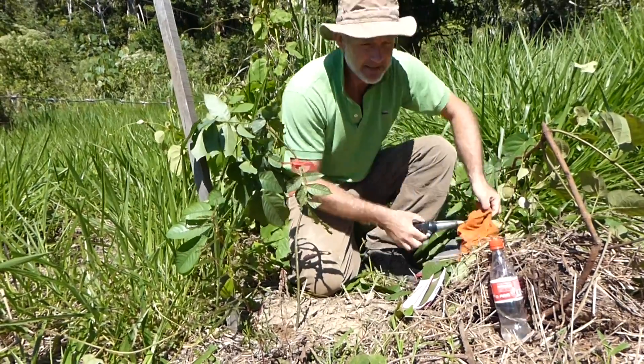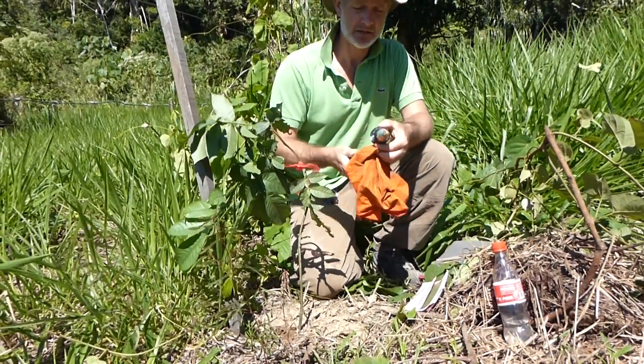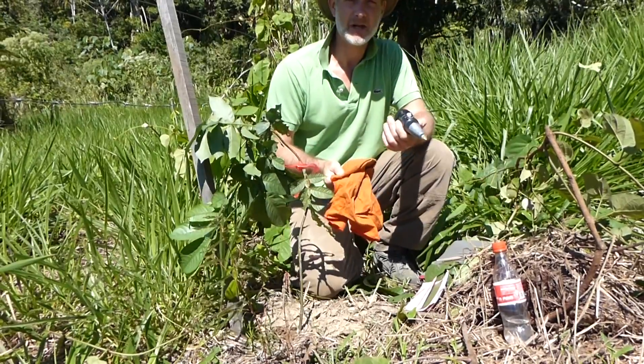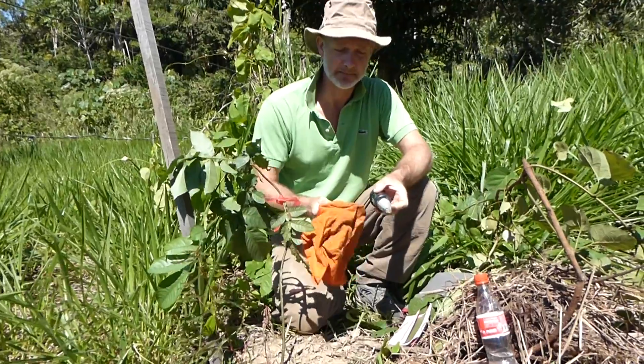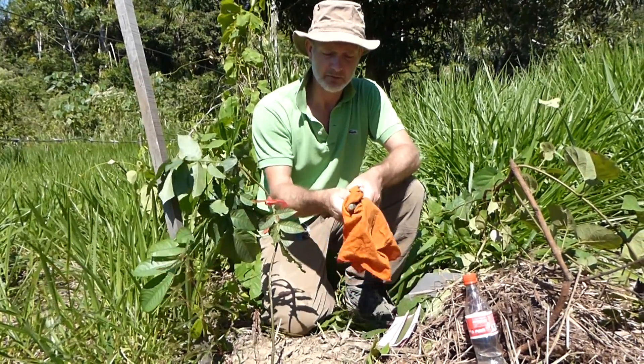In the meantime we're going to clean the meter. We need to clean these metal surfaces, and you must never touch them with your hands because the grease will stop it working properly. So we're going to wipe it clean with a cloth.